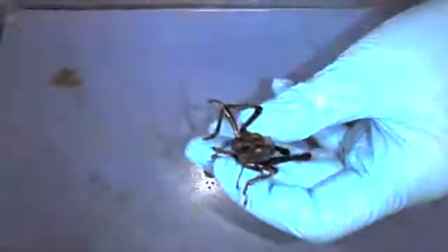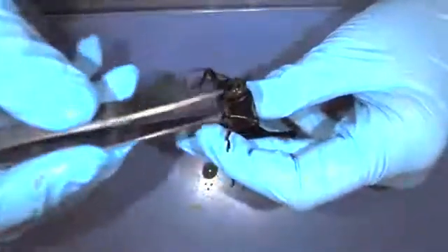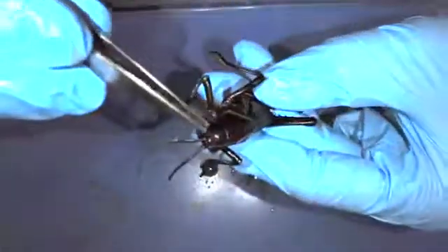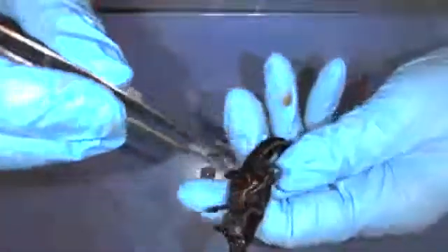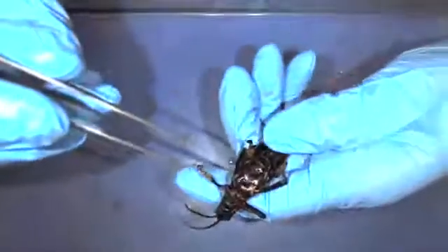Here's one antenna and here's the other — these are really good sensory organs that they use to sense vibrations in the ground for prey and predators. They have three ocelli, which are simple eyes located in the head, and then they have two compound eyes which can actually see a little bit better than our eyes — one right here and one right here.